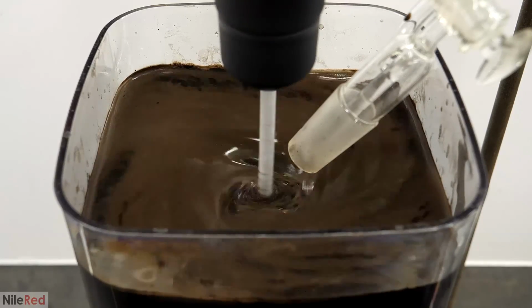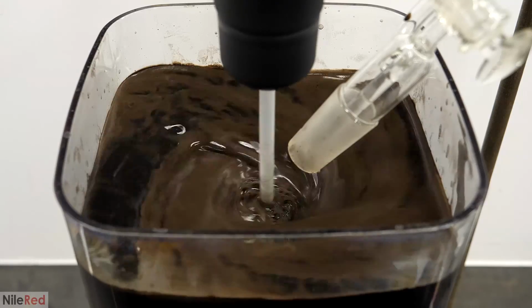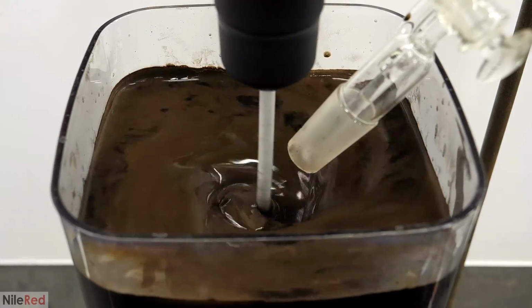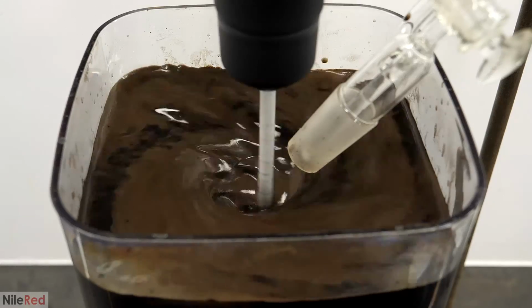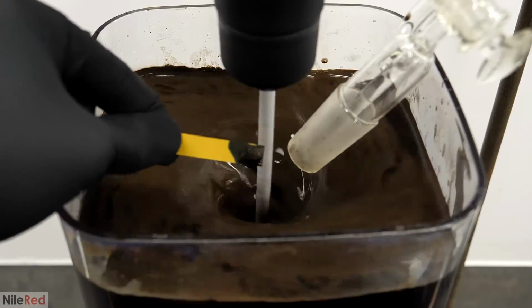This caused the magnetite to slowly separate out, and the goal was to bring the pH down to a bit below neutral, so around 6 to 7. For the majority of this acid addition though, things were pretty uneventful, and it didn't look like much was happening. All I did was just check the pH every few minutes to keep track of its progress.